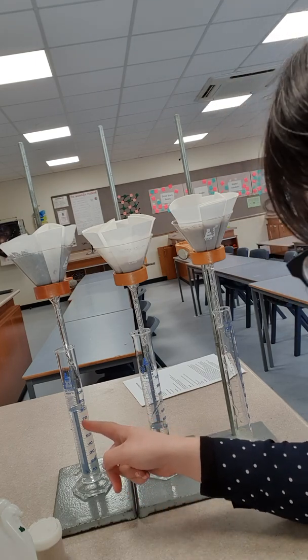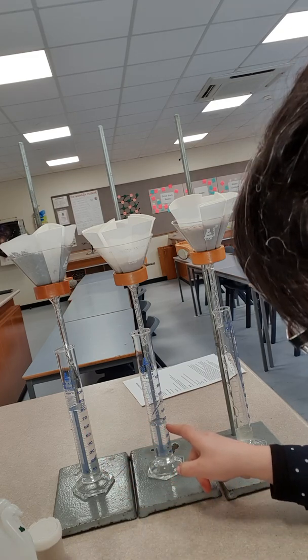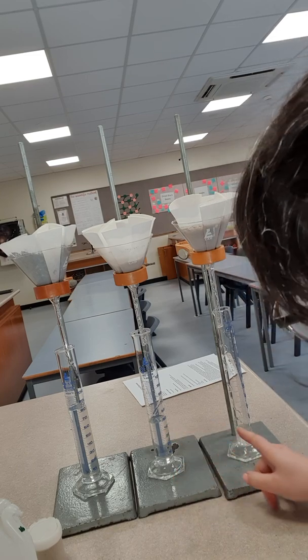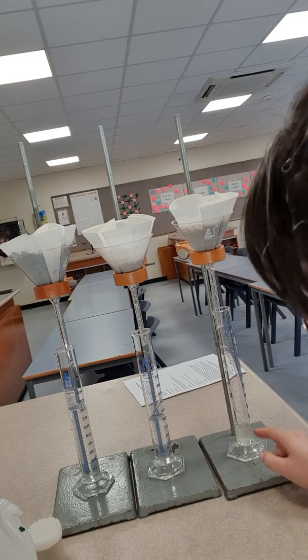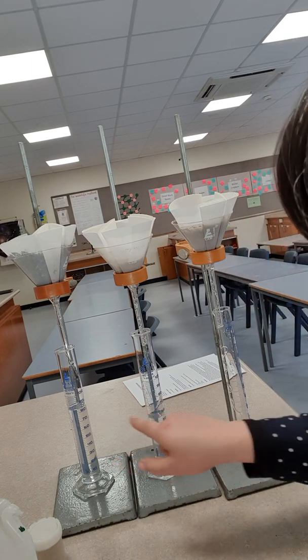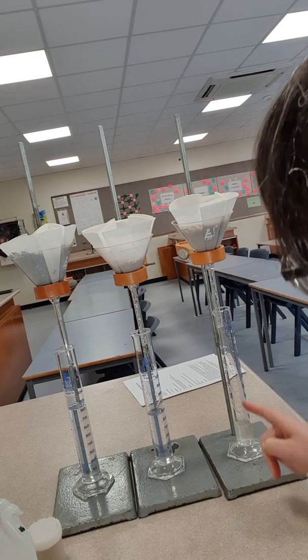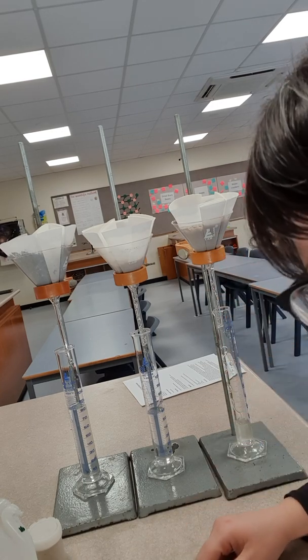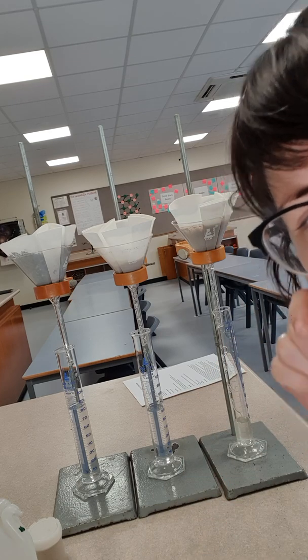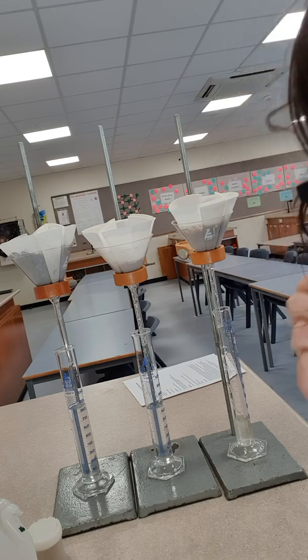You can already see this soil is up to 80 ml. Sand is rising right before your eyes. And then the clay, look at that, it's actually really interesting. The clay has made it cloudy. It's not cloudy in any of these ones. So that cloudiness has actually gone through the filter paper. The filter paper is not fine enough to get rid of that. But anyway, I'm going to pause this and I'll come back in like 5 minutes and we'll see what the results are.